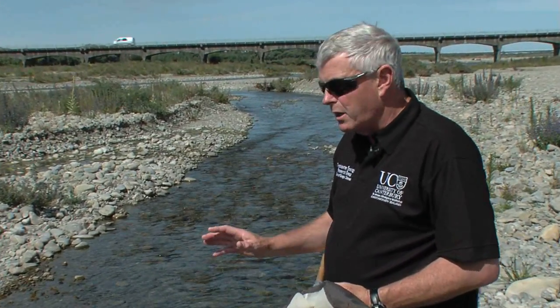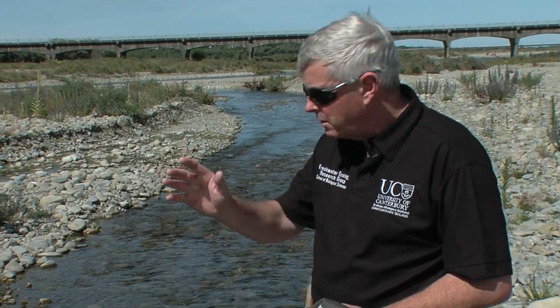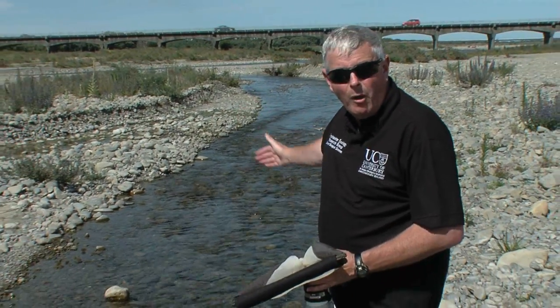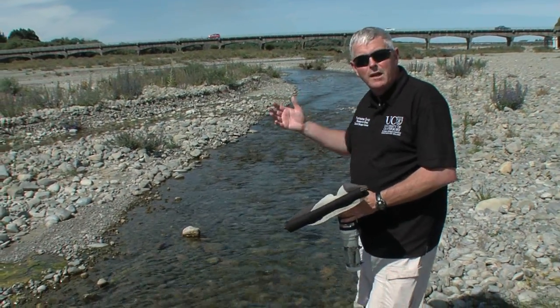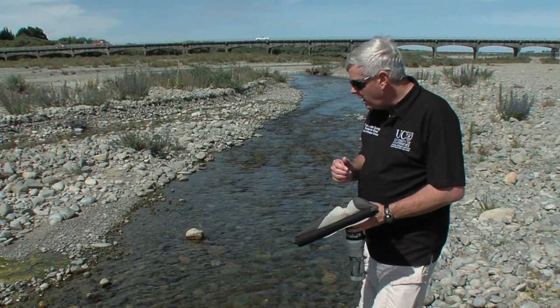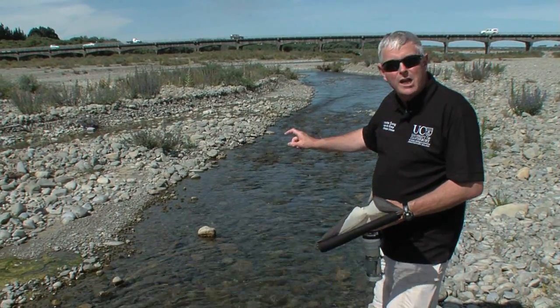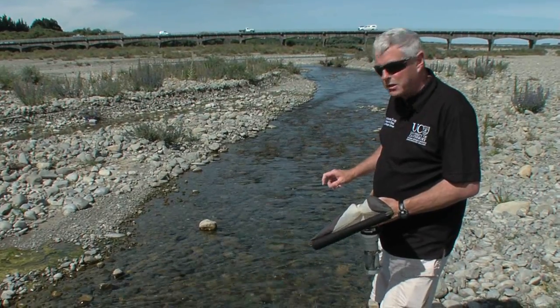One of the first things we're going to do is have a look at our reach and decide where we're going to sample. We usually work from the bottom up so that we're not disturbing the area that we've just been over. With this sort of sample, we want to actually sample a range of habitats within the stream.